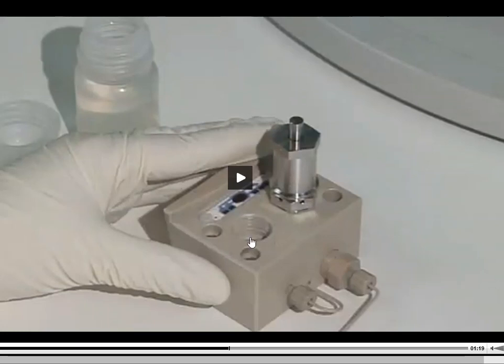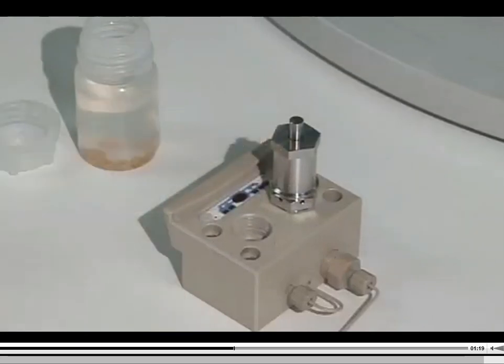If these seals go bad, what's going to happen is that your pump begins to leak. And if you have a leaky pump, then your flow rates are not going to stay the same. Your pressure cannot build up. You're going to have leaks all over on the inside of the instrument. And, you know, good luck if the instrument runs for you at that time. So you're probably not going to be able to do anything with it at all.